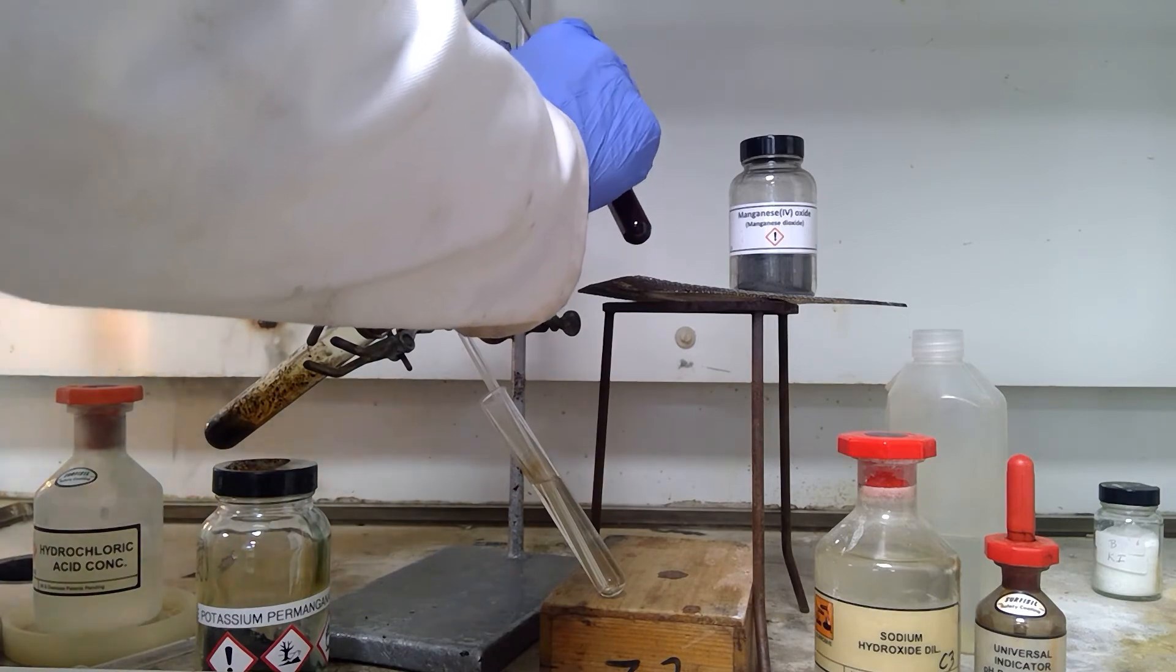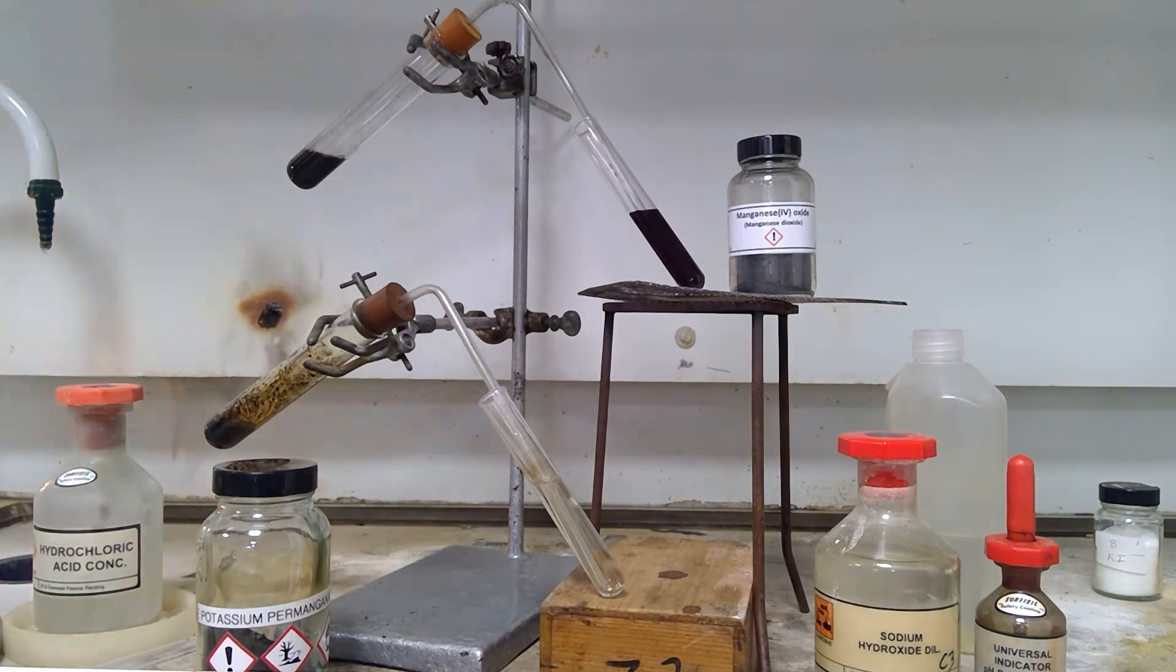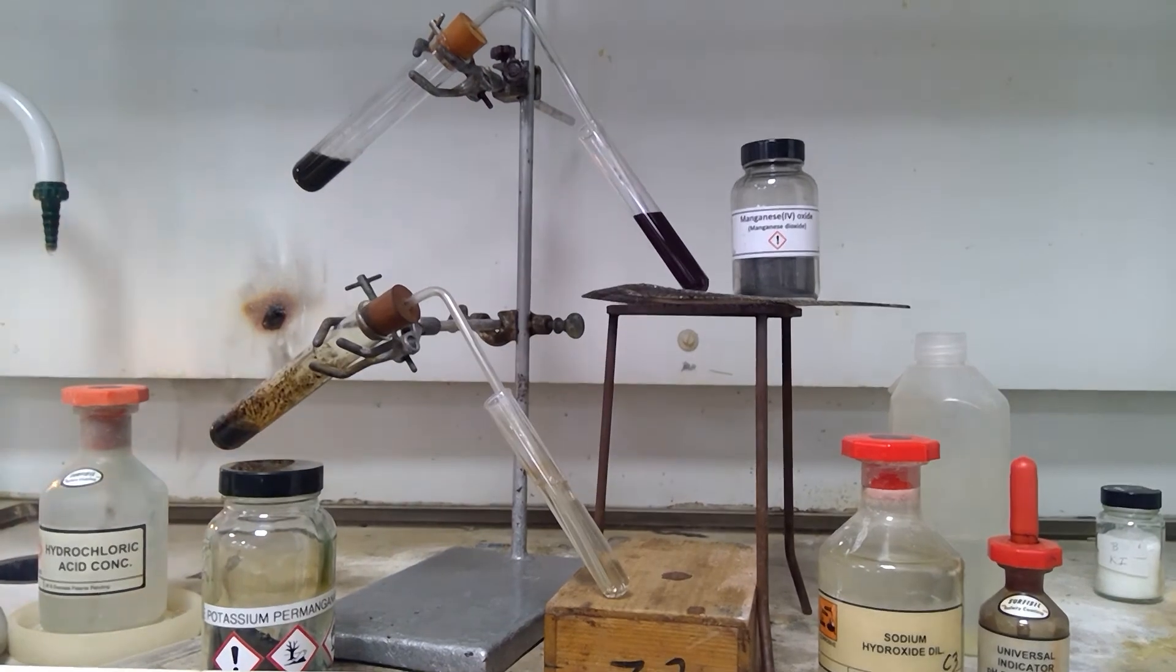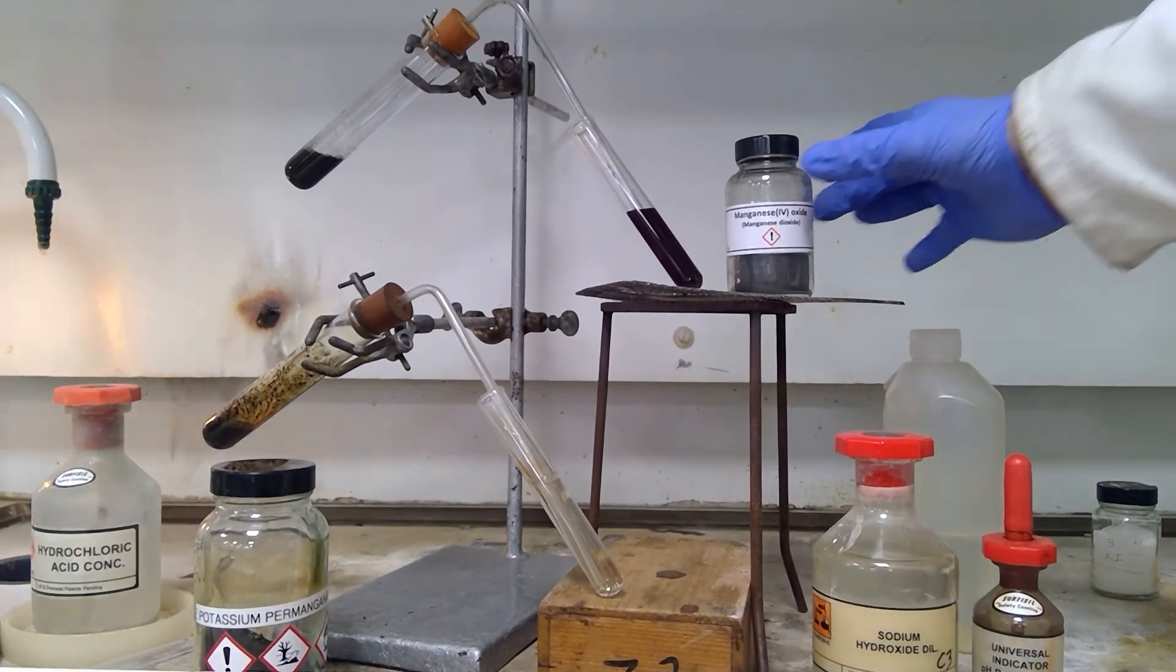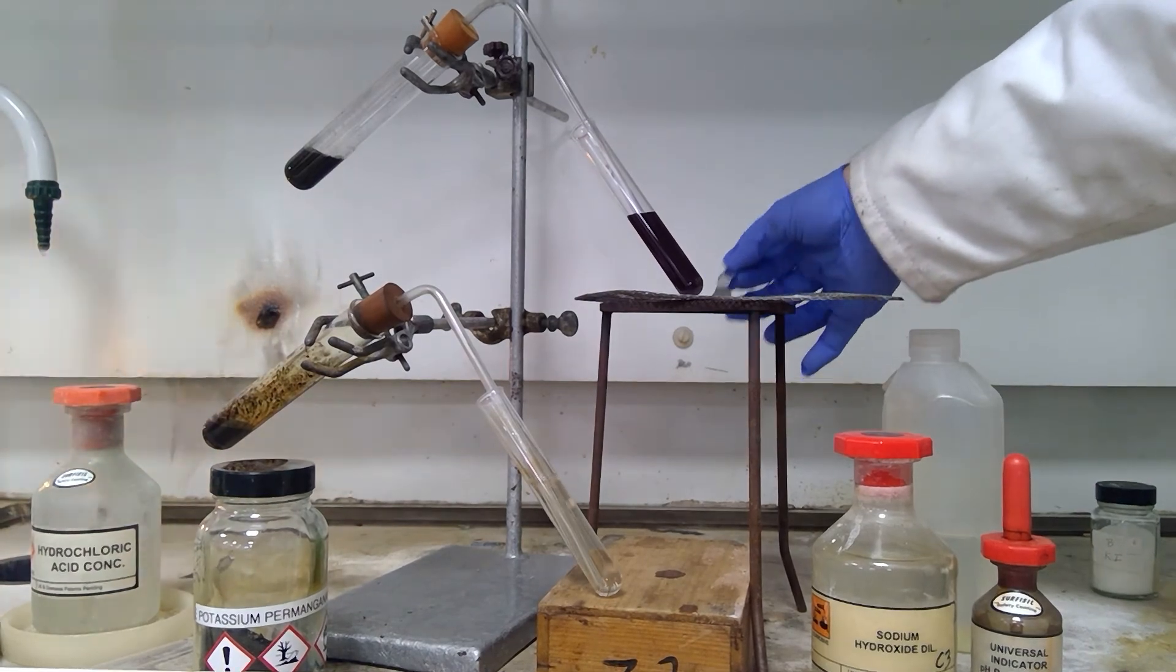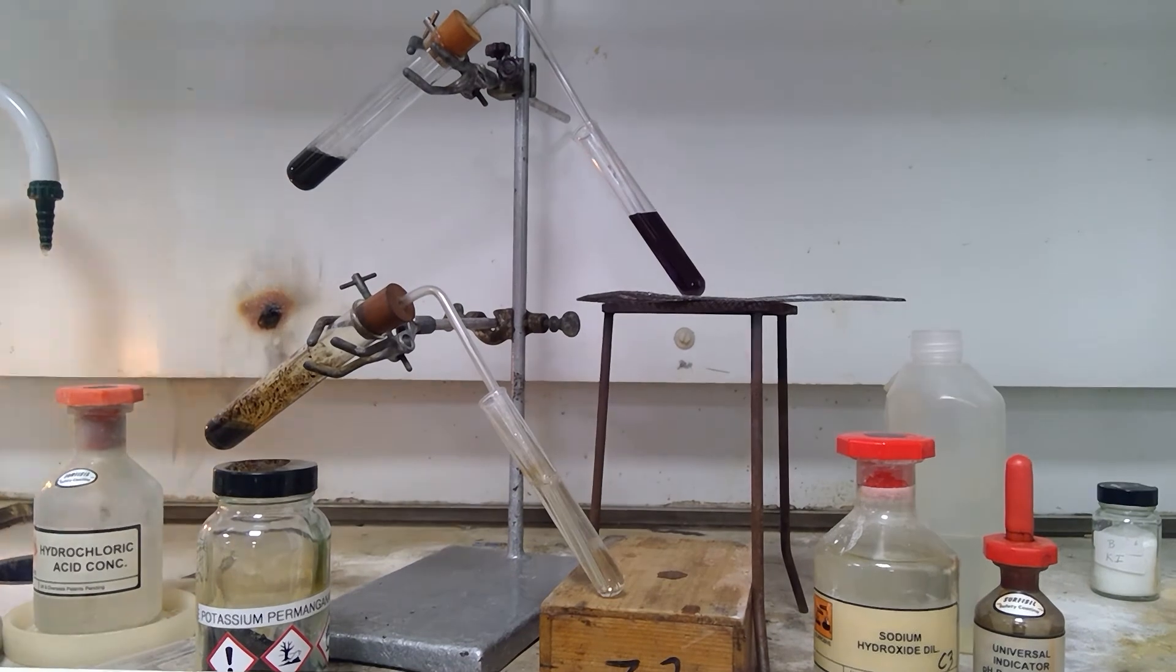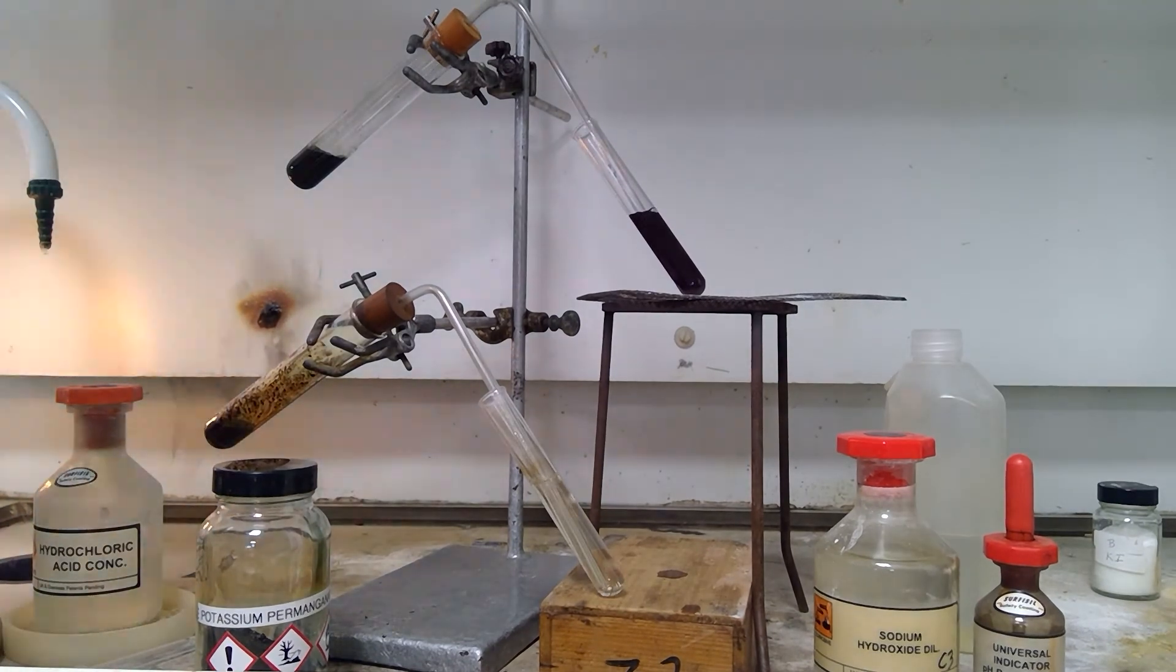So, is there any signs of gas? Nothing too obvious. There may be a little bit eventually.